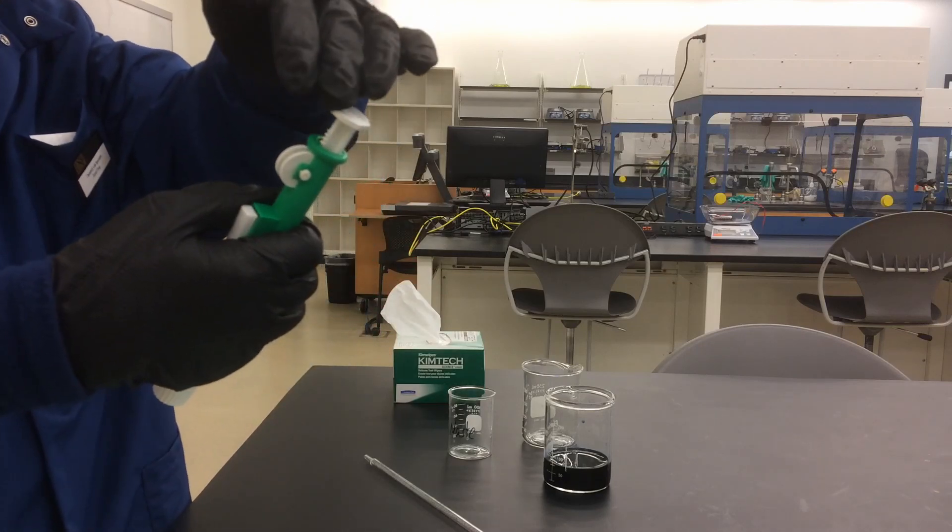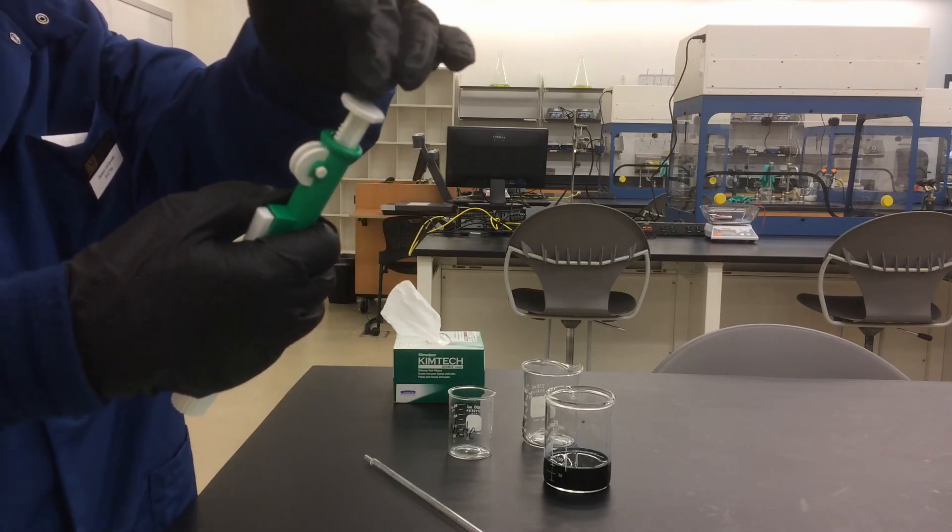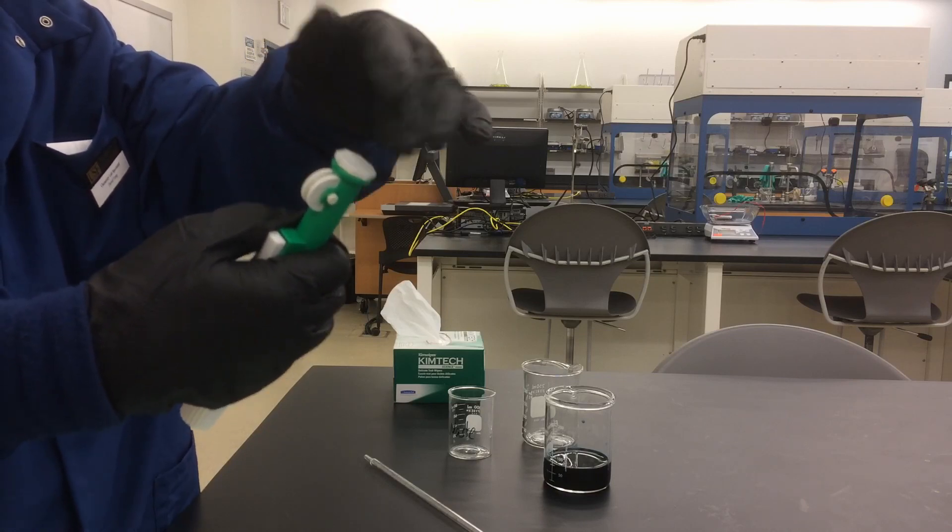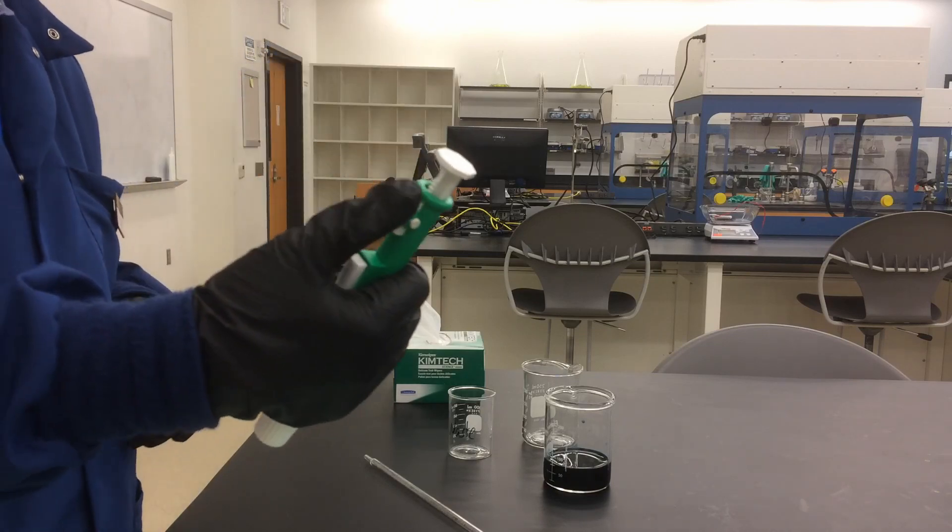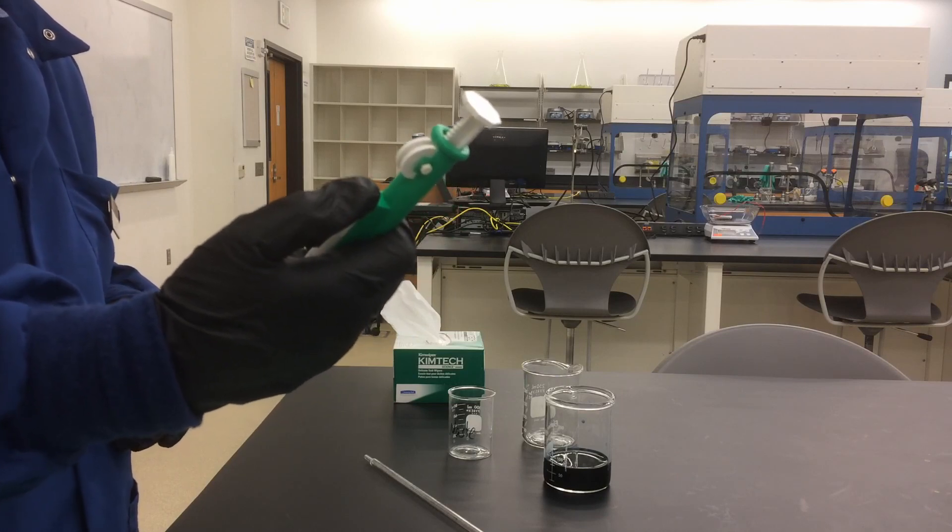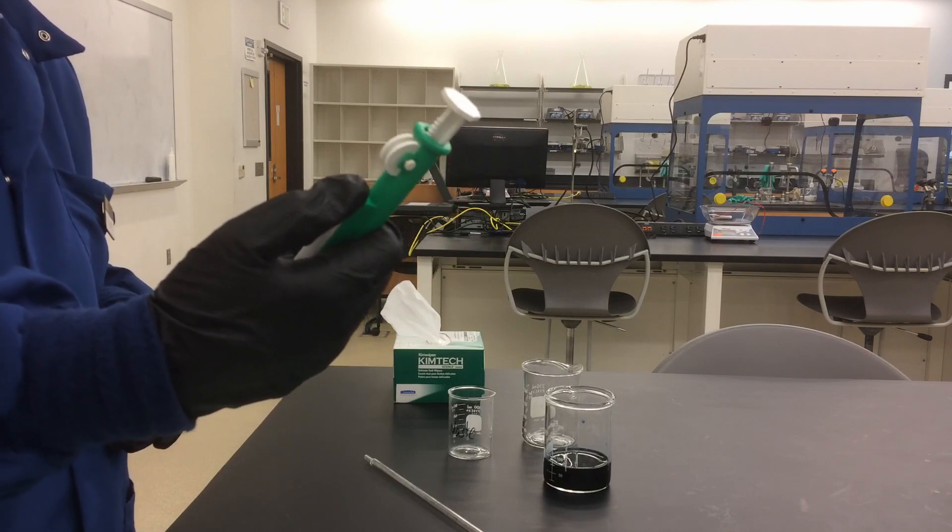You never want to drain solution using the top of the pump here. You never want to do that. After you draw the solution, you tap the wheel to drain the solution.